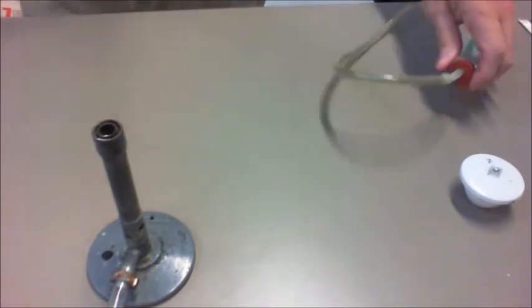Now, the one that we're going to be breaking down today is a metal carbonate, and in particular the metal carbonate of copper carbonate.